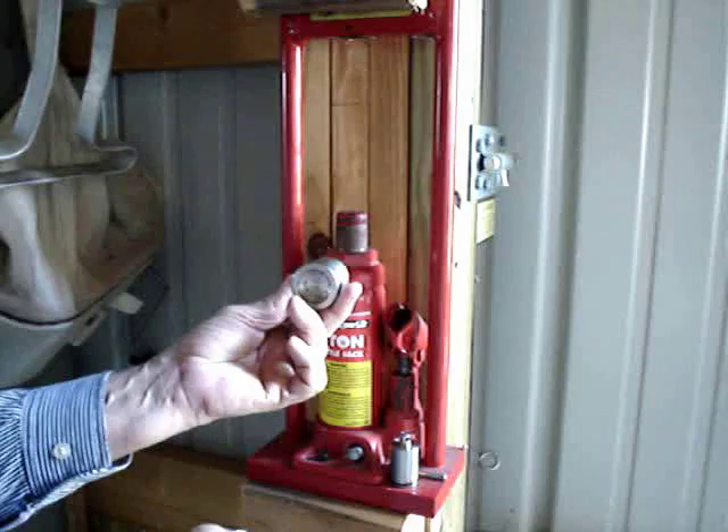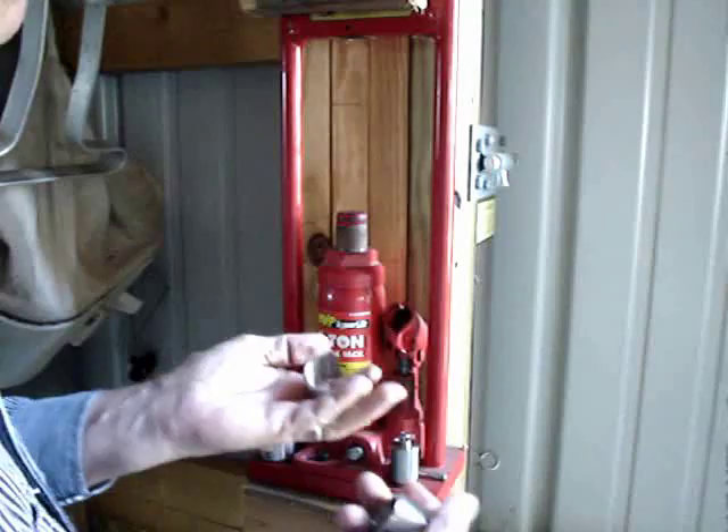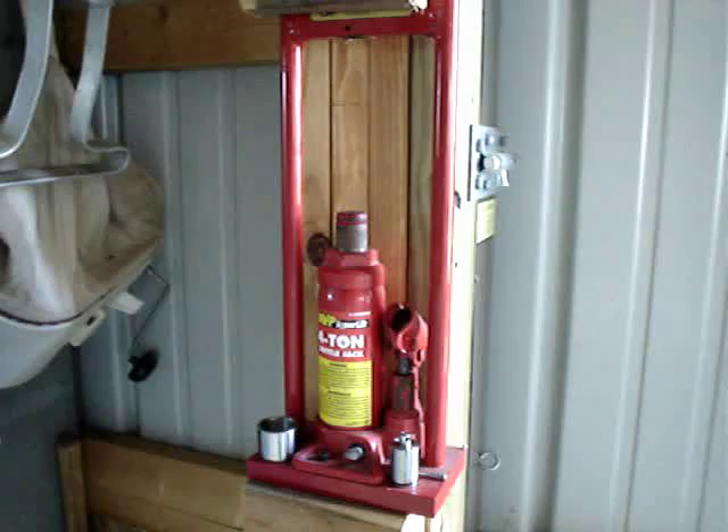Here is a receptacle fitting. We have various cups that will work in this process. We have a sample chamber, so let's start out and see what we can do with this.